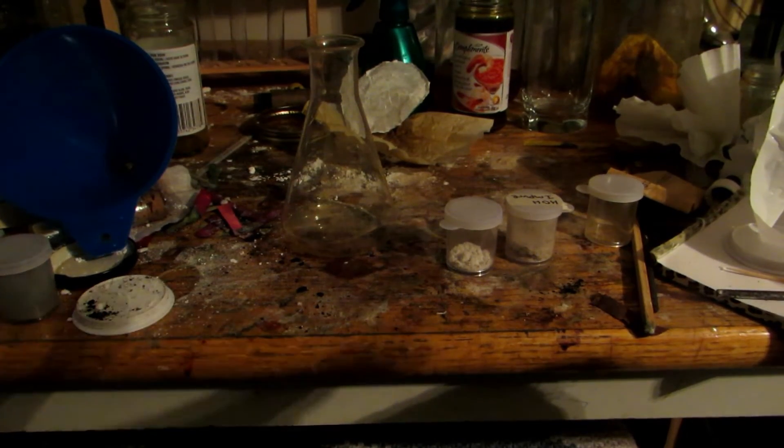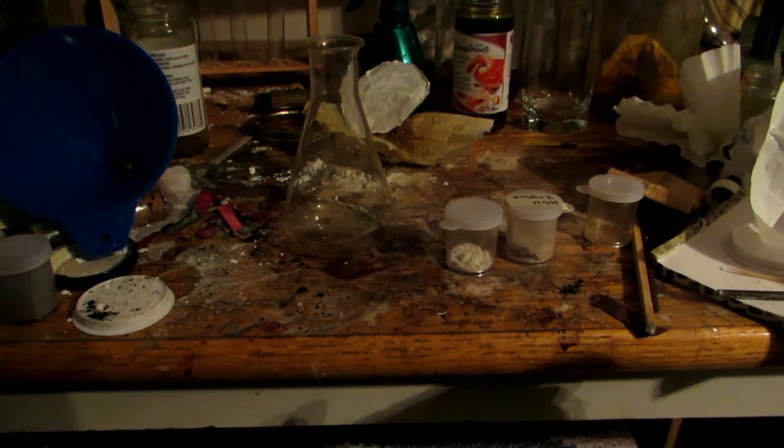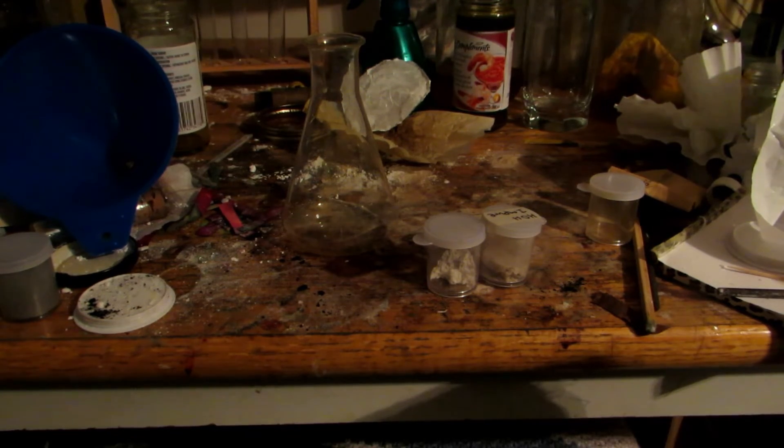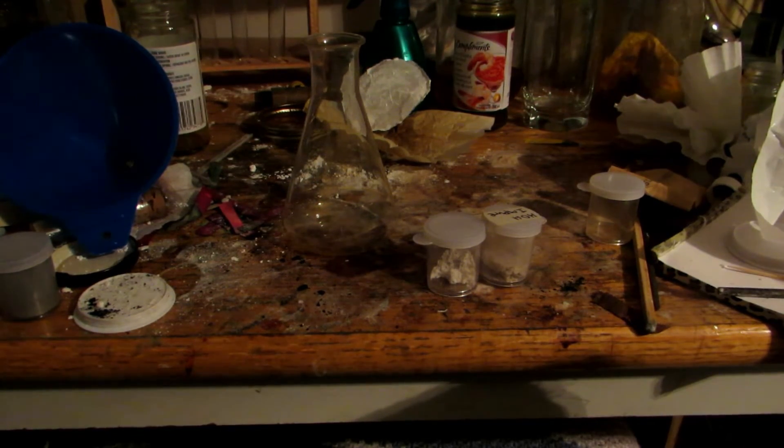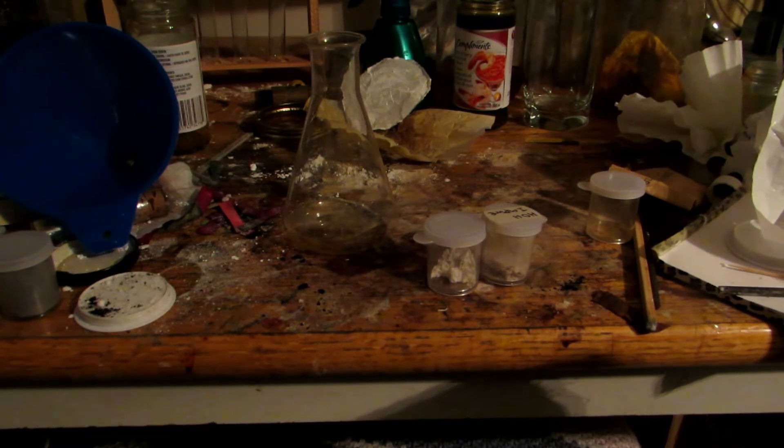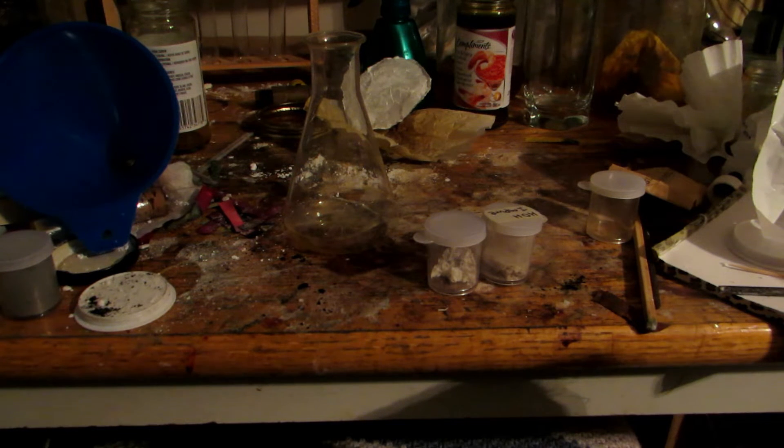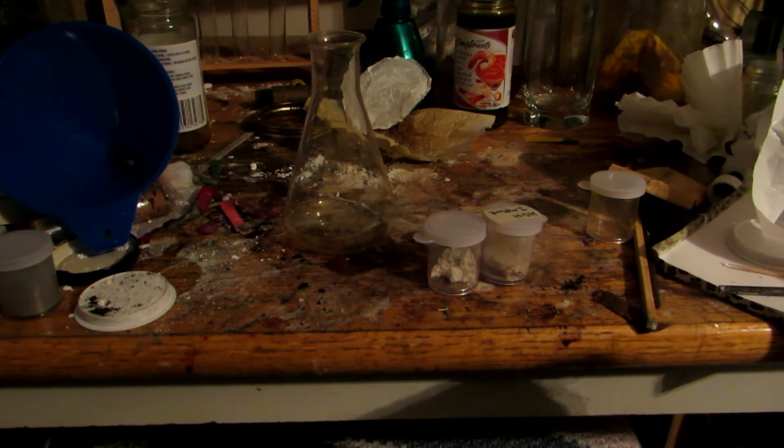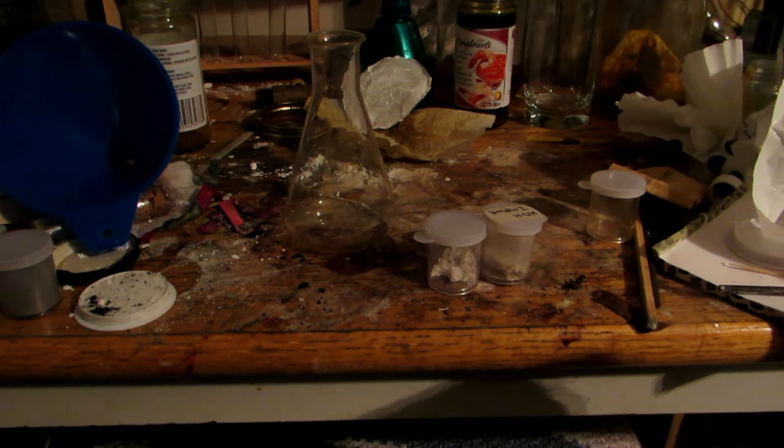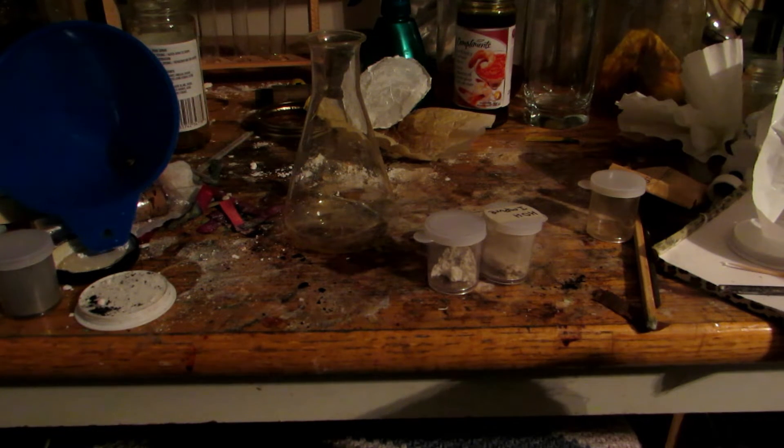Okay, so this is quickly for both methods to produce potassium hydroxide that I've showed. You can see we have the potassium hydroxide from each method. And I'm just doing it at the same time because I want to save ethanol. So in a previous video, we actually distilled some nice 95% pure ethanol, and we're going to be using this because potassium hydroxide is quite soluble in ethanol. However, potassium carbonate is essentially insoluble in ethanol, so that leaves us an excellent method to separate them because our potassium carbonate can simply be filtered off, and our potassium hydroxide will be in solution and can be boiled down to obtain the pure potassium hydroxide.